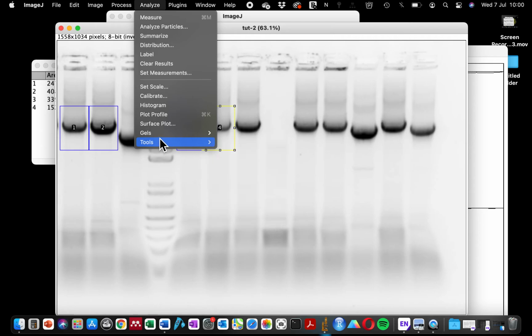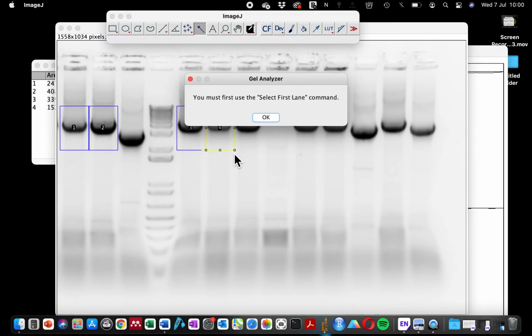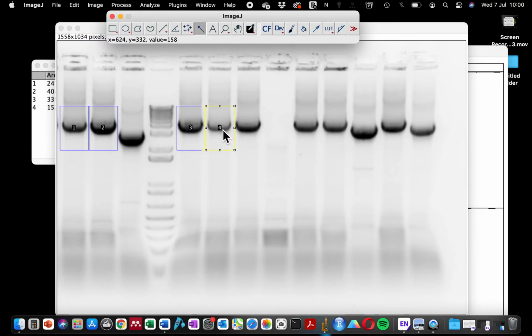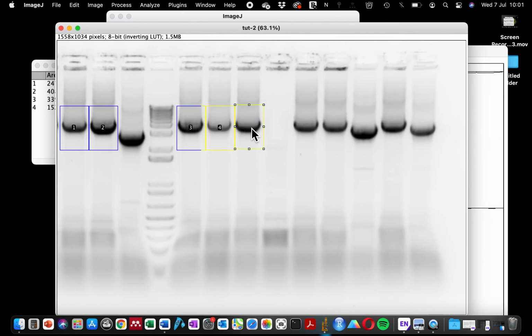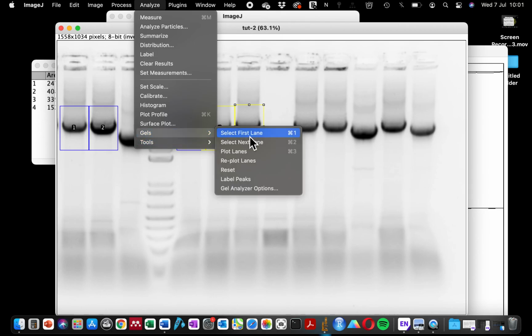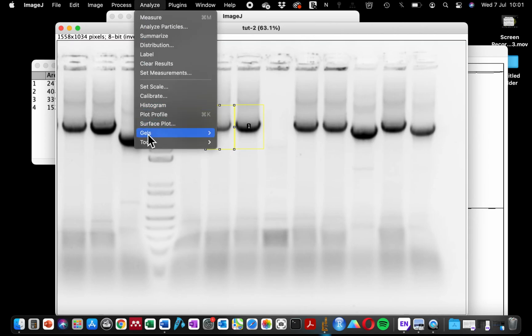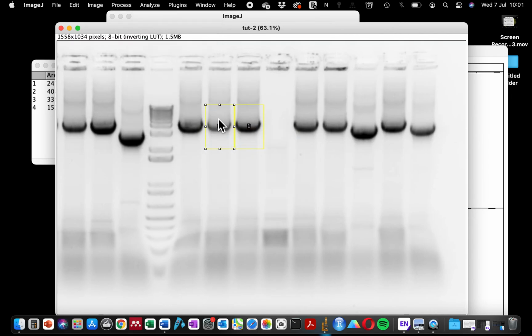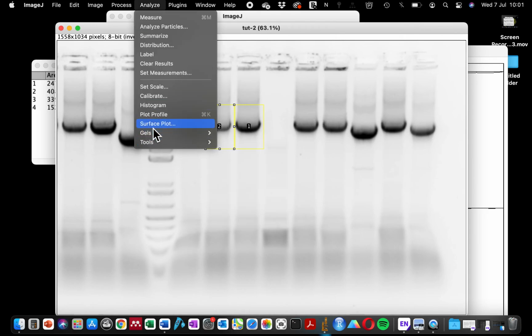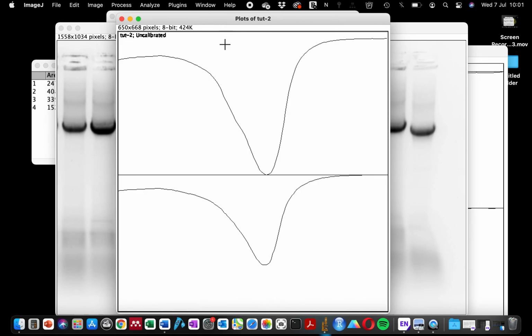Okay, let me quickly troubleshoot the problem that you can come across when you are doing your gel quantification. And this is plot lane. I'm replotting, because I've used this before. I have to select the first lane again. So that's our first lane. On this weak signal, I'm going to select it as our second lane. I'm going to stop at 2 in order to not take much of your time. And then I'm going to plot lane. You see, after I've plotted the lane, I had the peak for both.